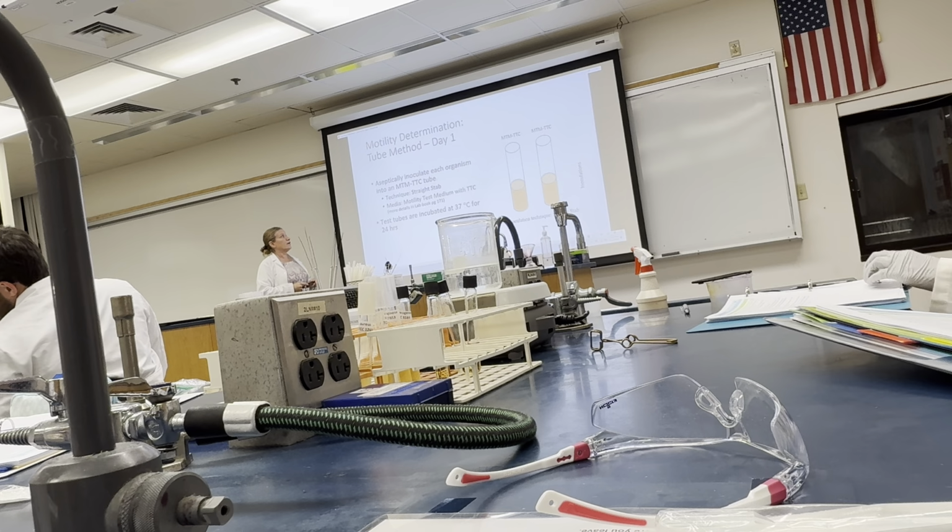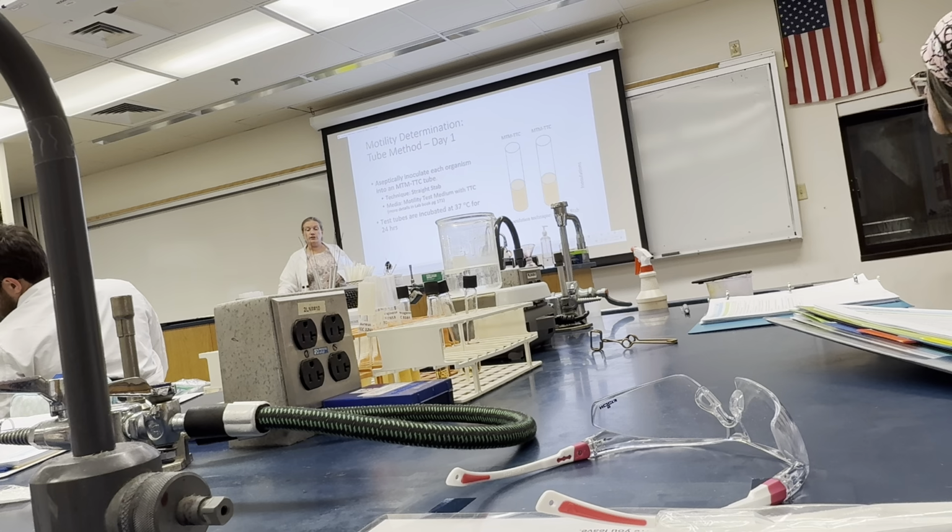Okay, all right. Now, how are we going to inoculate this media? The inoculation technique that we're going to do is what we call a straight stab.